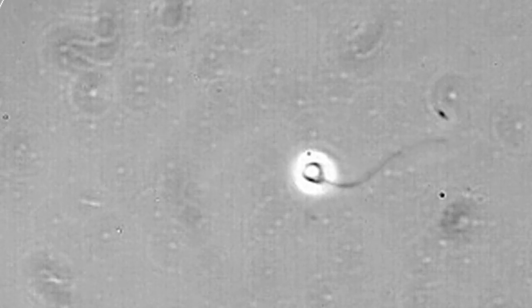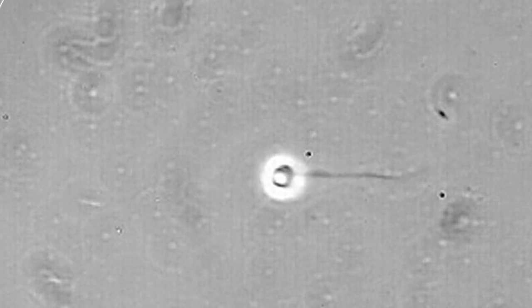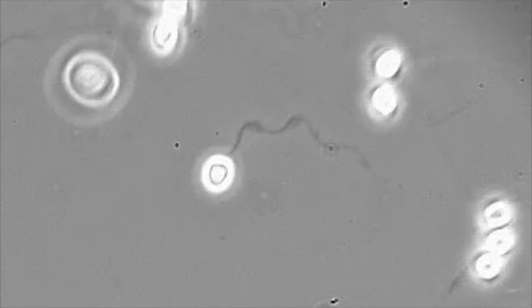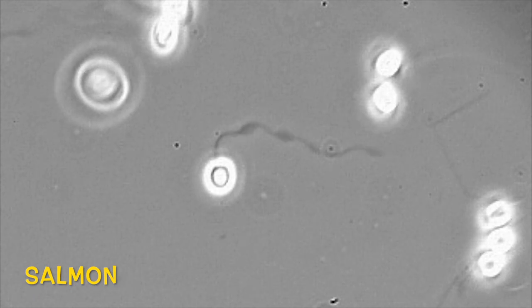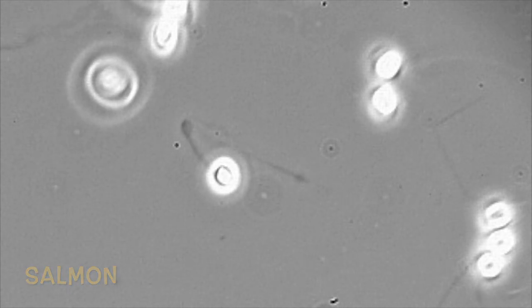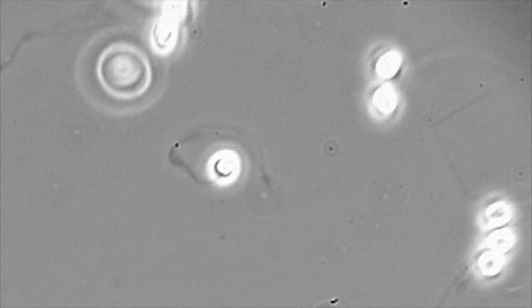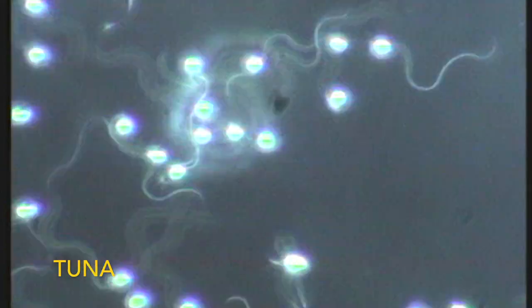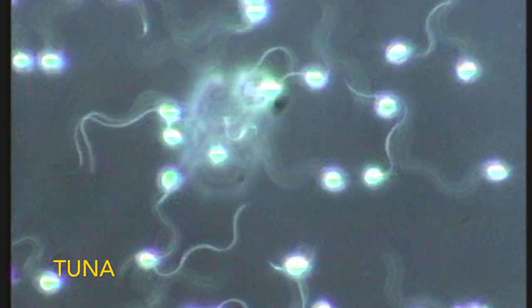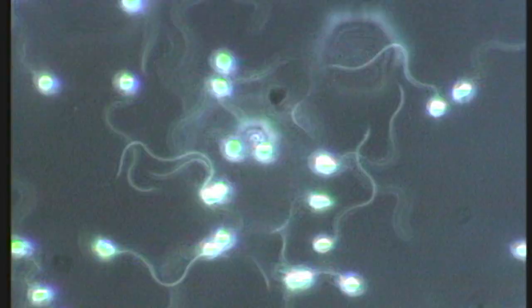We see that in this species the flagellum of the spermatozoa is very short. In the case of salmon sperm, the flagellum presents rapidly some blebs that contribute to stop the movement. Here we see tuna spermatozoa swimming at real speed.